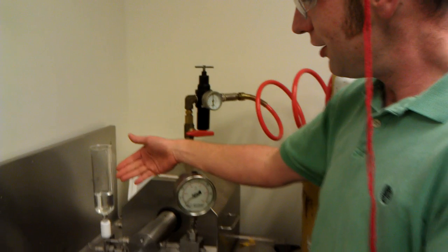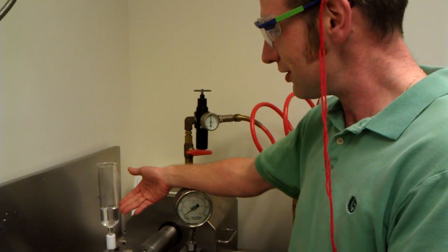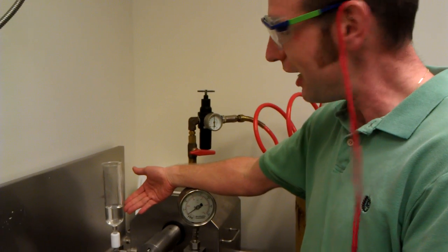Once you're finished with this, make sure that the funnel doesn't run dry ever. Because if it does, it has to be reprimed because of the air in the system.